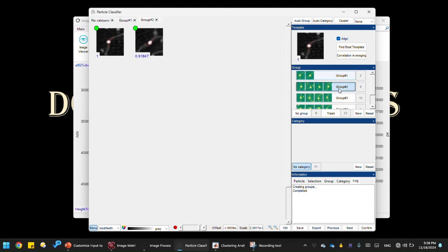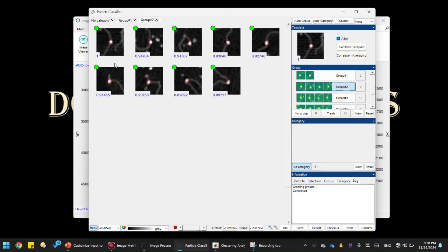Let's go to the second group. You can see that the first two, we already took the alignment, right? It's aligned by its correlation to the template particle, which is the first one. It has a correlation number of 1, and the number indicates how closely it correlates with the template, which is the first particle. So you can see the first two match pretty well, but then it goes to the third particle, which is an end particle, which has nothing to do with the first two. It looks nothing similar to that. And the fourth one is okay. The fifth one is an unbent state, so it's not similar to the first two. That's a bent state, right? And the last few are sharply bent, and they're not similar to the first two.